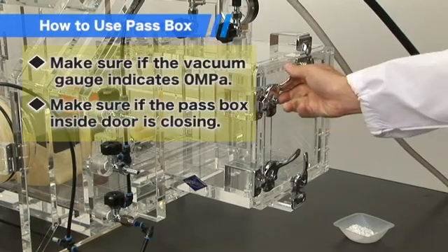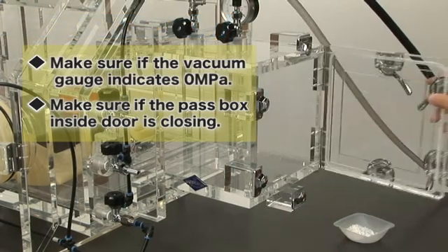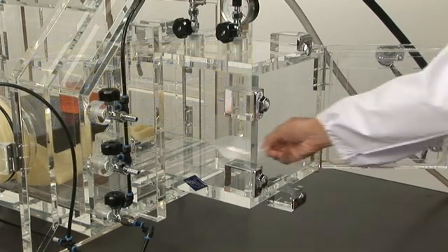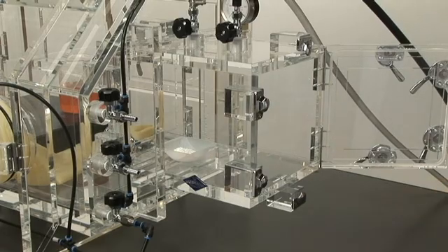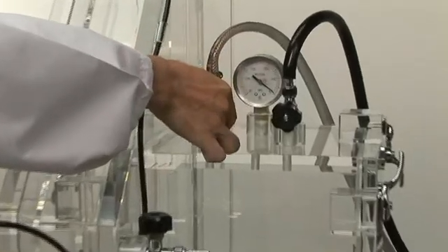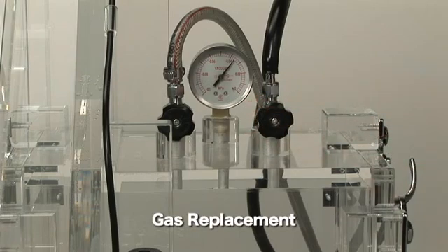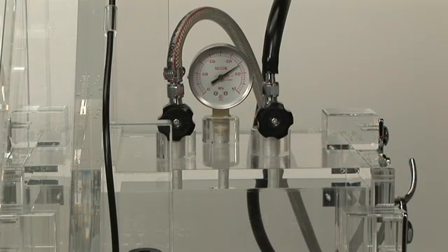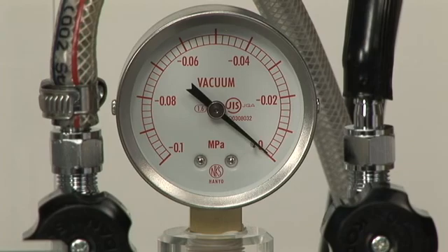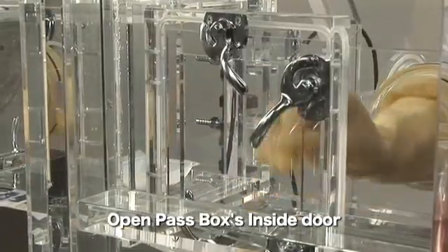When putting items into the main box of the glovebox, make sure of these things. Open the pass box's outside door, put items into the pass box, and then close the door. After that, do decompression and gas replacement in the same steps as the main box. After the pressure in the pass box has reached atmospheric pressure, open the pass box's inside door and put the items in.